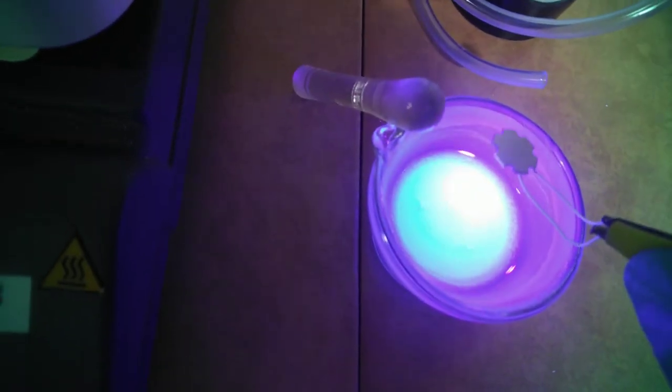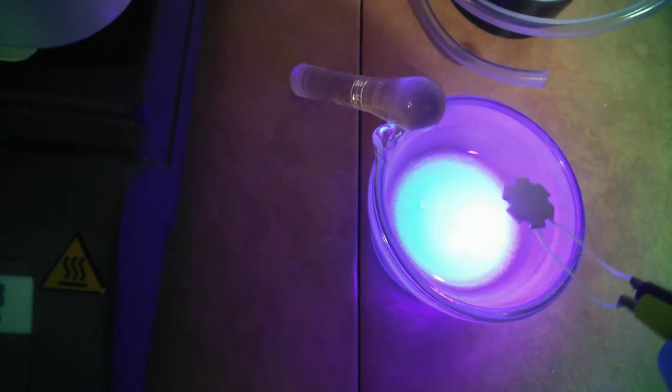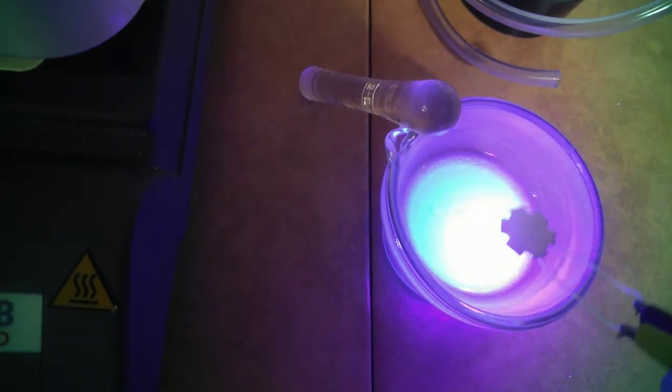My camera, unfortunately, does not show the color correctly. In reality it is a deeper blue.